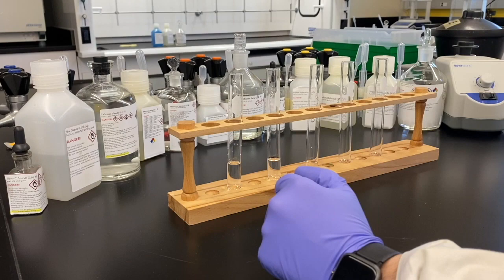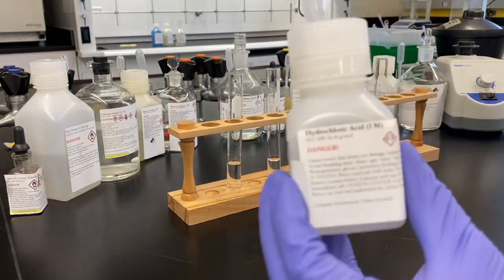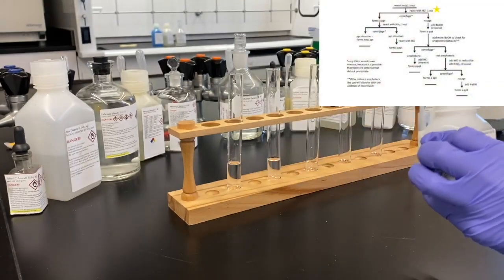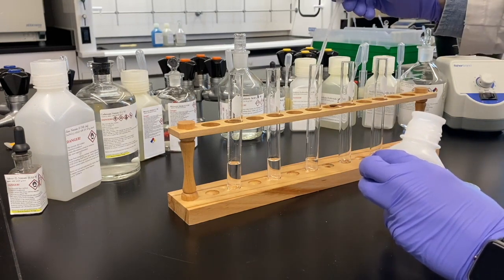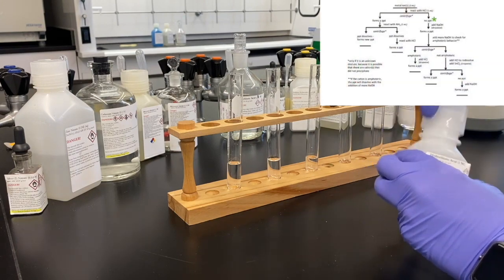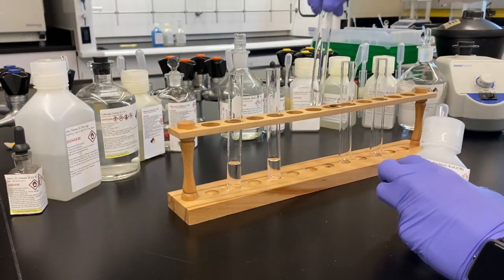On to our third unknown, cadmium nitrate. Again, first step is add acid. We keep adding a lower concentration of acid, just 1 molar to start. Though we have 1, 3, and 6 molar acids available, if we start with 6 molar, we're going to have a lot of base to add to neutralize it. So we're going to start with 1 molar. So cadmium chloride would be soluble.